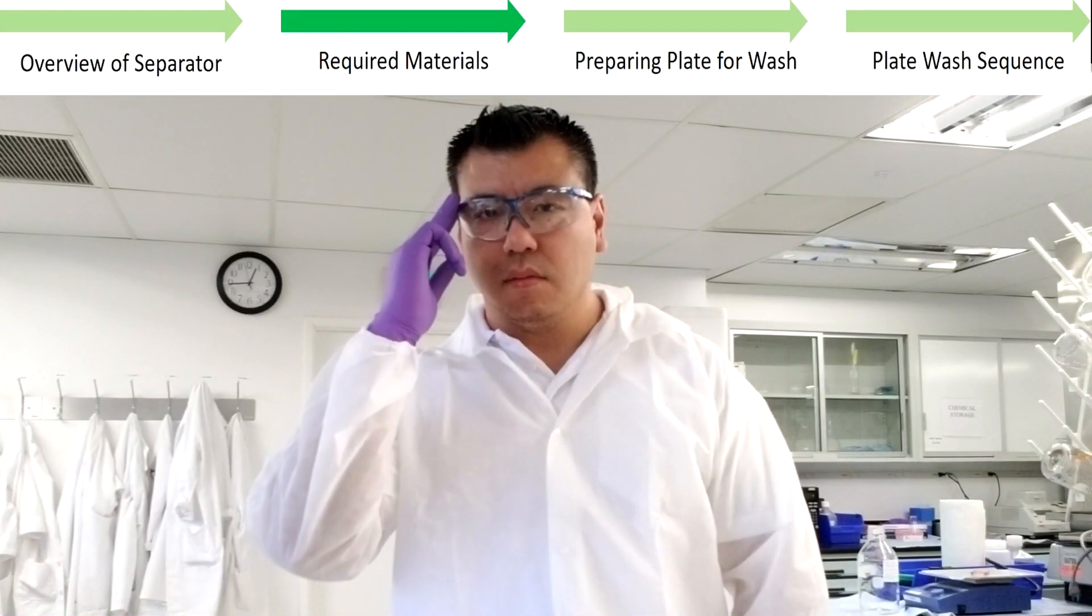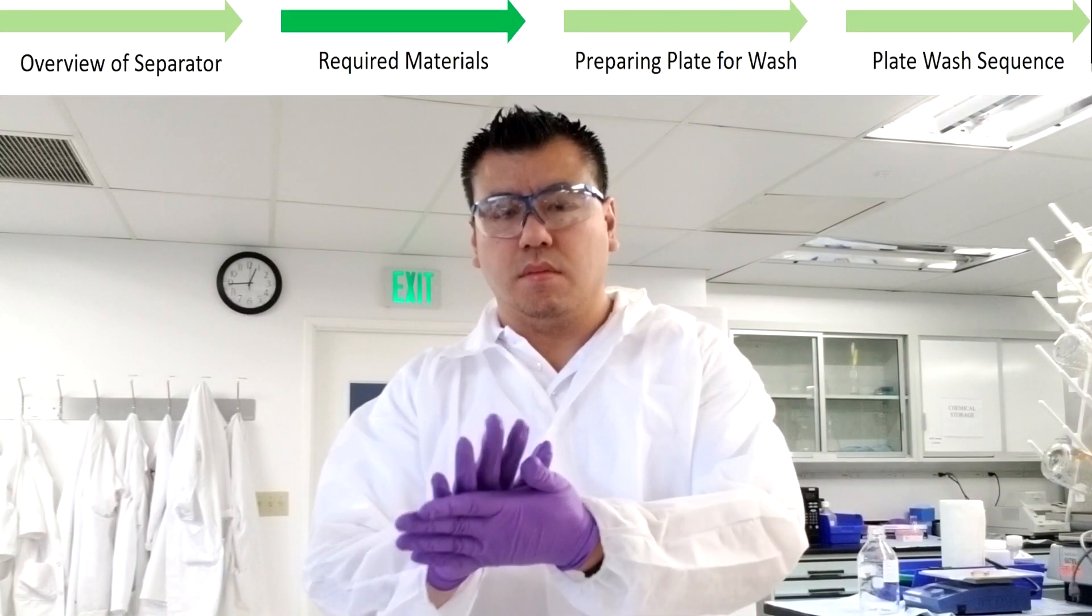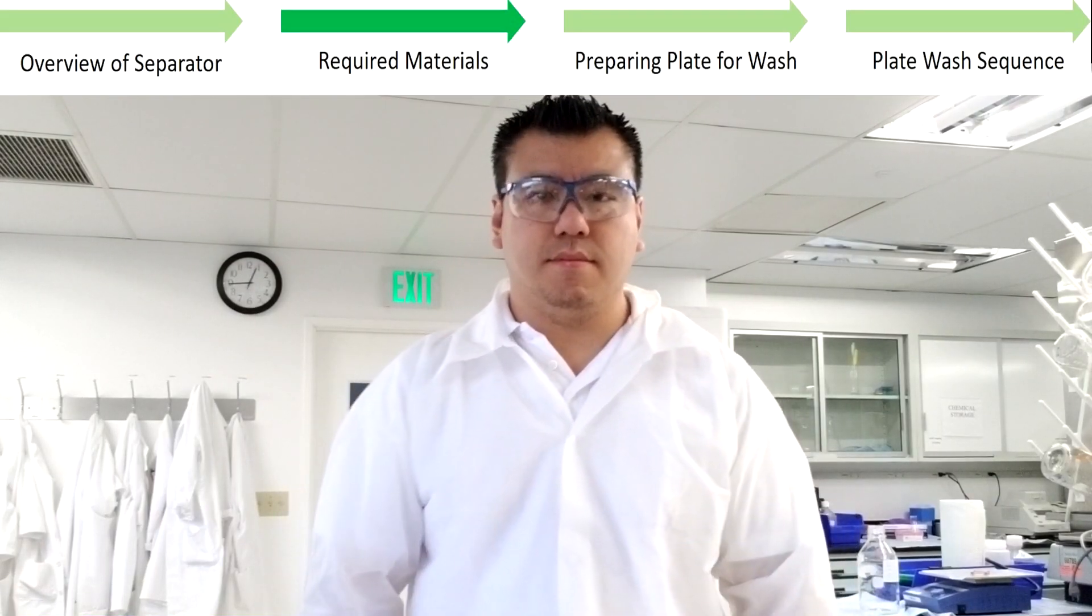Of course, please remember to wear safety glasses, gloves, and lab coat when working with MillPlex assays.